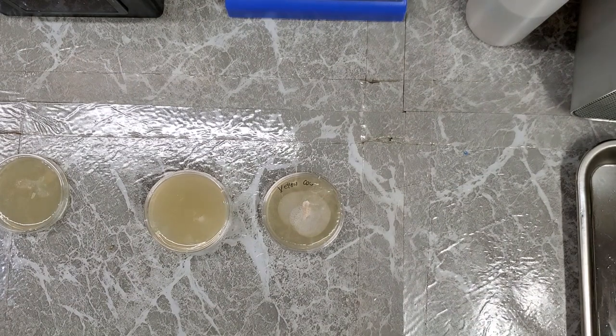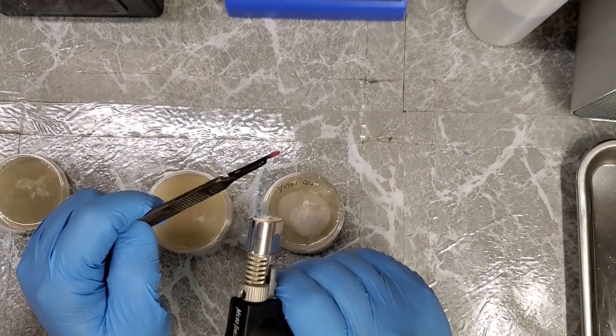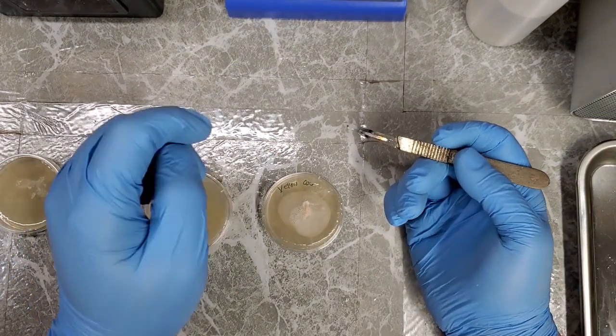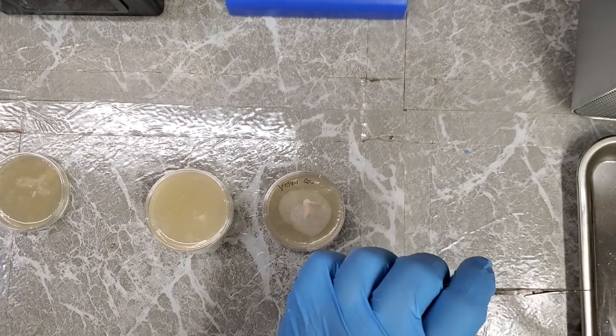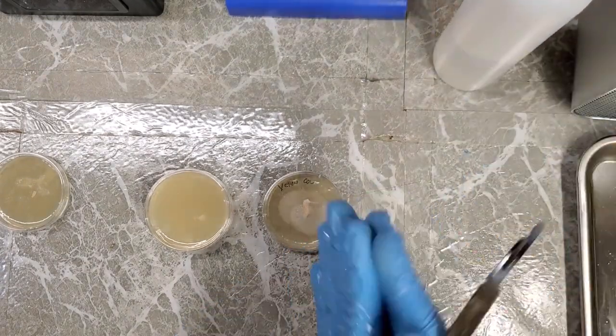Sterilize. Well, let me flame sterilize my scalpel blade. Let that cool down for a second. While that's cooling down, since I touched that, I'm going to spray my hands down with some more alcohol.